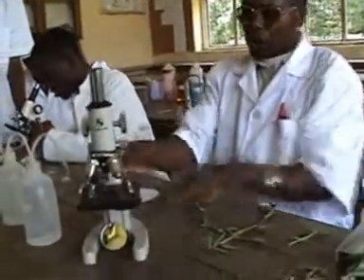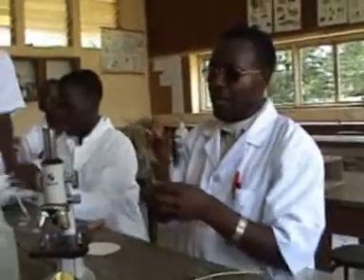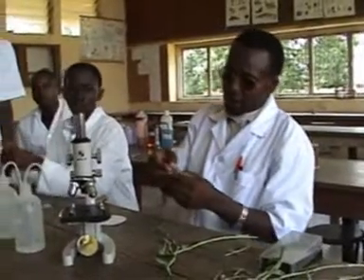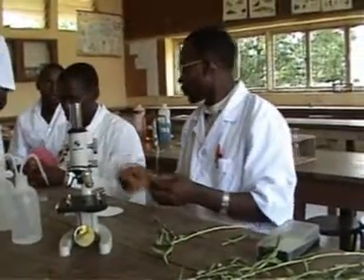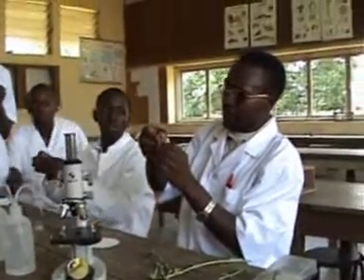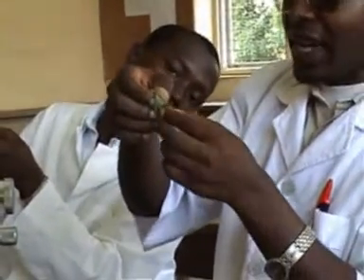So now, to prepare a slide of the leaf of this commelina, what the candidate is required to do is to cut one leaf. He has to make about 2 or 3 trials. He cuts one leaf, he holds it and lets the upper epidermis be facing him or her, and then the lower epidermis be facing down. So I'm doing what I'm doing. So when you hold it now, what you do is to break it. So you break it from the upper epidermis like that, and then you try to be tearing it.